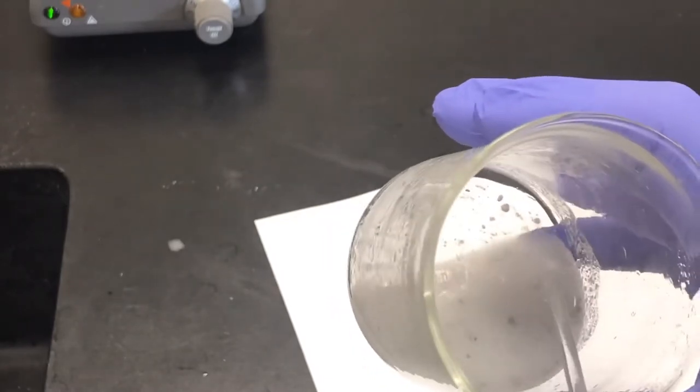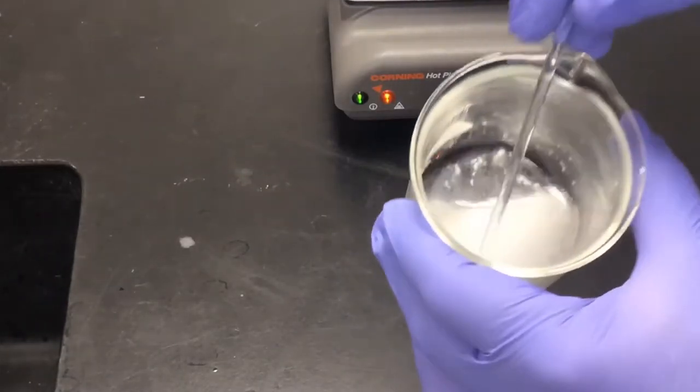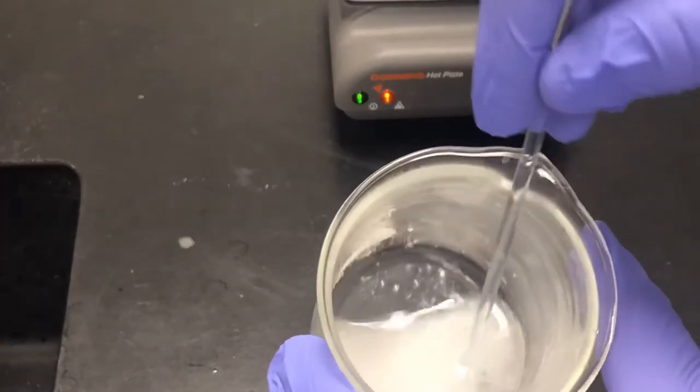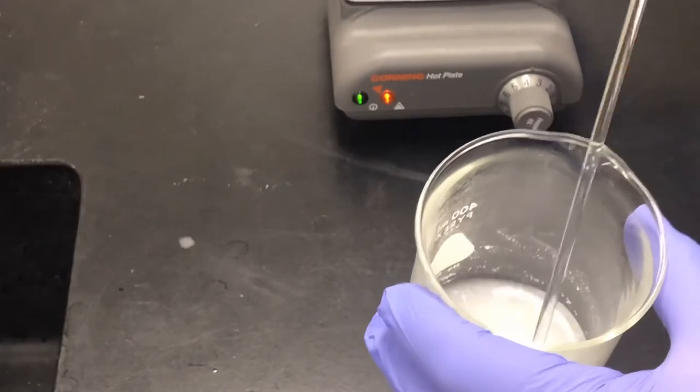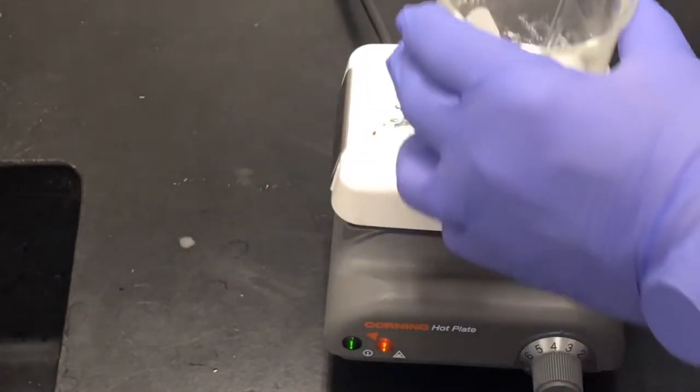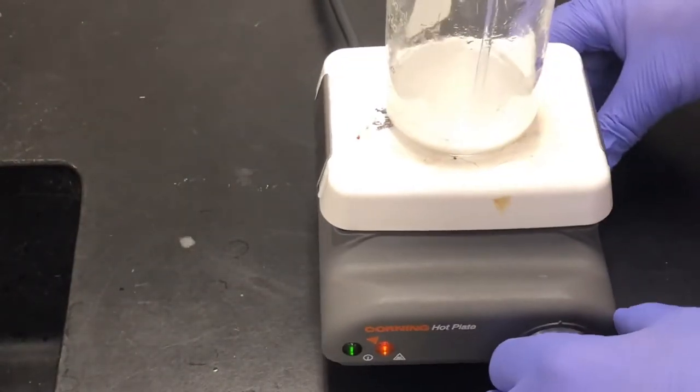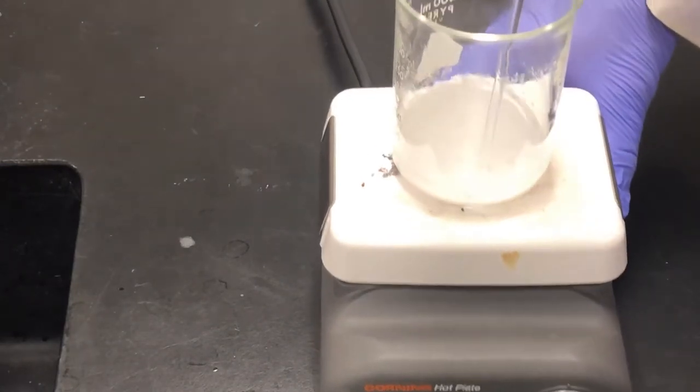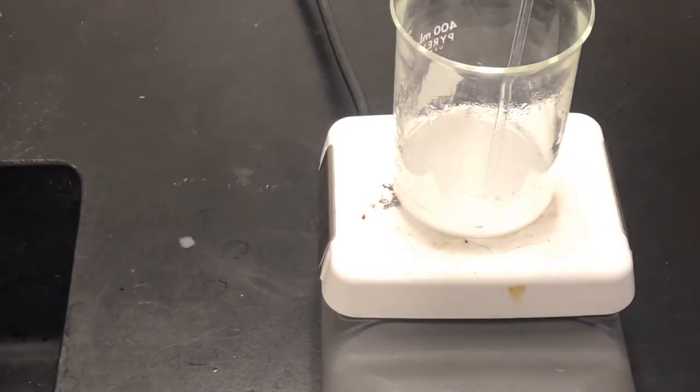So what I want to show you is that we do have some white crystals in here. We know that the solubility curve with temperature, we know if we heat this up we will try to get these dissolved. The tricky part is we want to get all of these dissolved into solution.